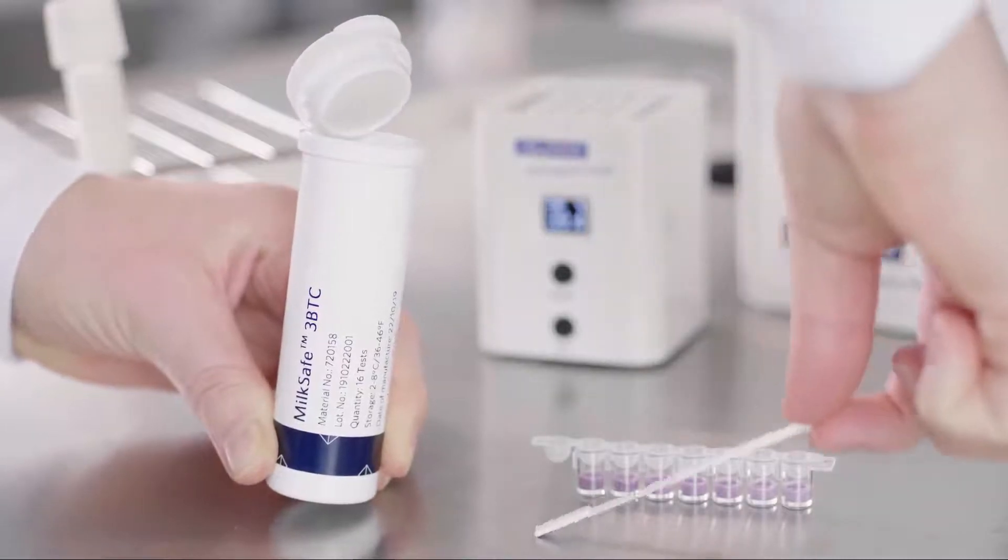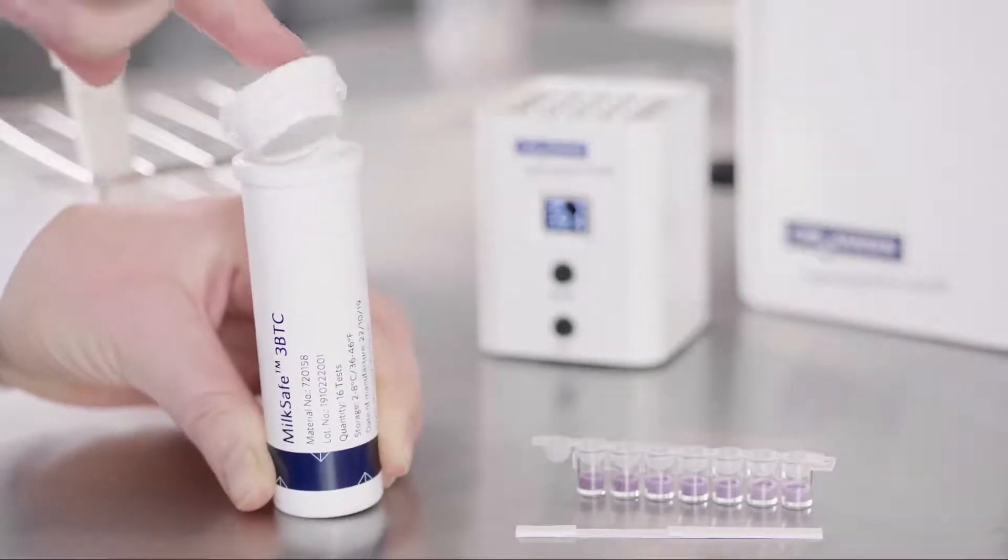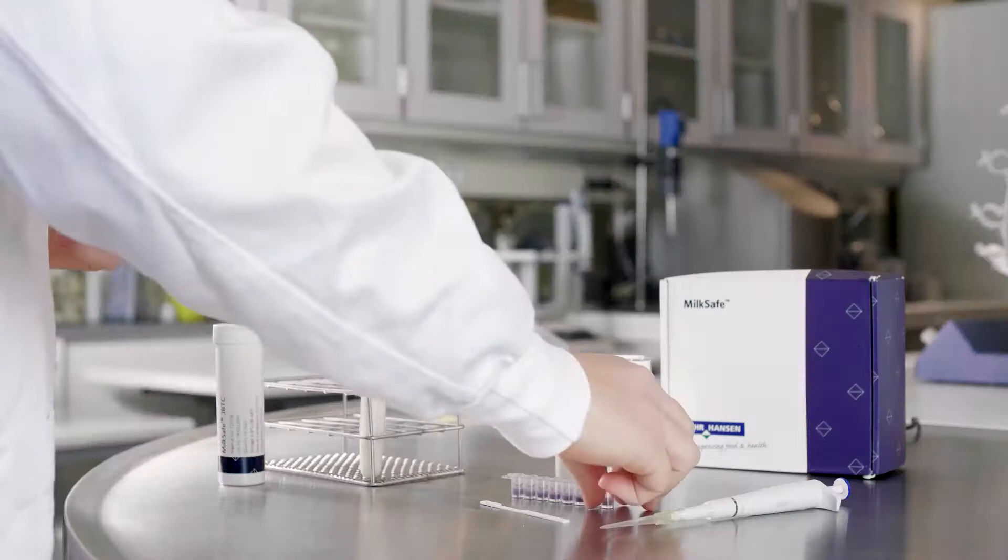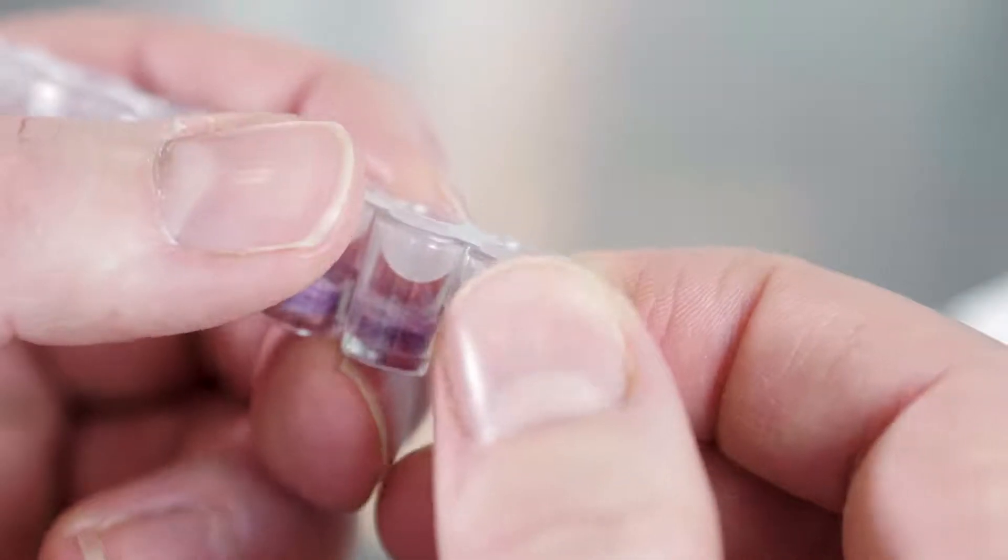Collect the required number of microwells and test strips from the canister. The wells are easy to break apart as shown here.